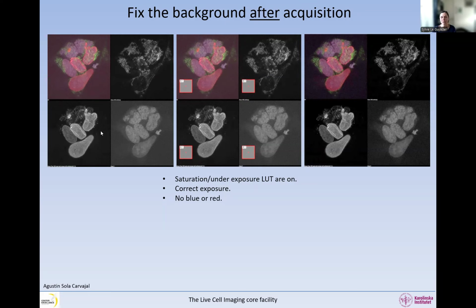What is the difference between acquiring an image like this and subtracting the background, or acquiring directly like this? In here you have all the fine details. When I subtract the average in this area, I preserve all the fine detail at the edges, but I make the background darker. That is the main difference, and it's a very important one, because in here you're not preventing the detector from acquiring the dim signal in the image. You don't want to do that.